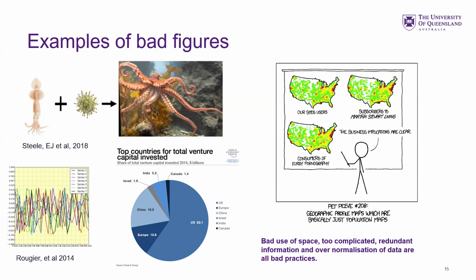What is that trying to say? You know, the graph here, it's in here, the last one. The graph here is way too complicated. You can't even tell the color of the lines. Here, it's really hard to see some of the color differences. There's redundant things like finding out a list of the colors here, but it's only one.